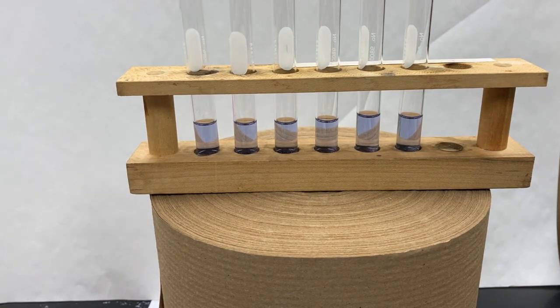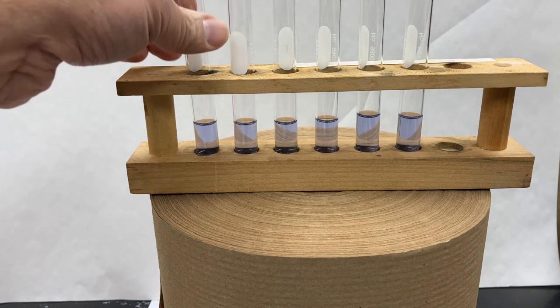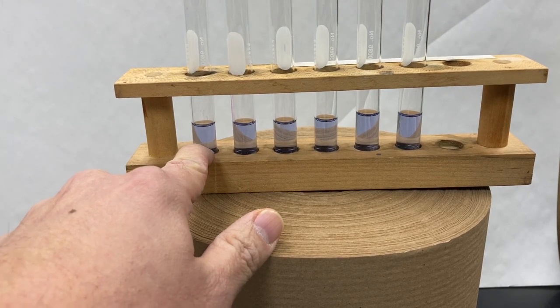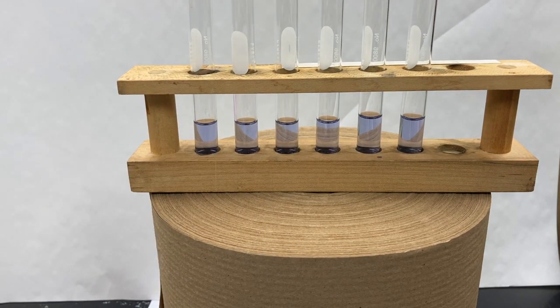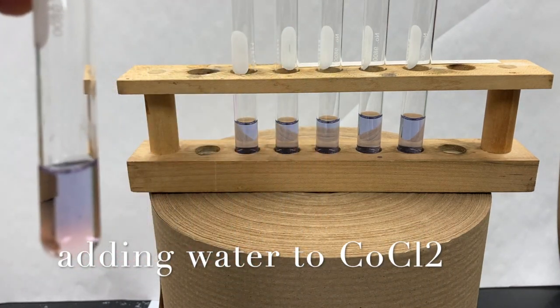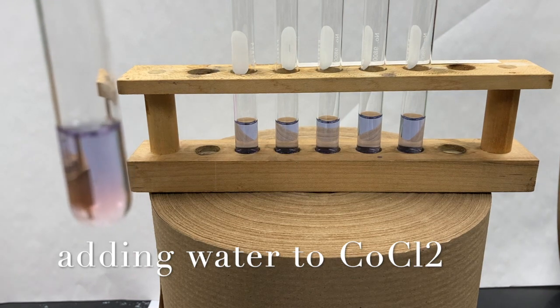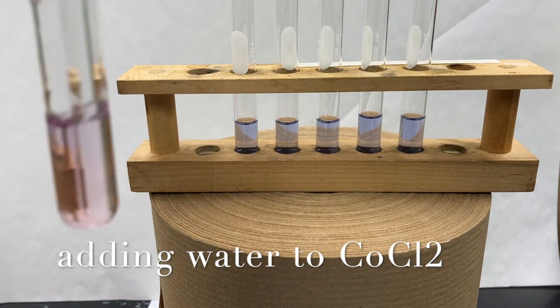So we're going to start reacting tube 2. And to tube 2, we're going to add water. As I mentioned earlier, the cobalt chloride right now is dissolved in ethanol. It's not dissolved in water. So let's see if there's a change by adding water to it. We'll do one drop at a time. You can almost see there's a little bit of a color gradient there. Almost got lighter at the bottom.